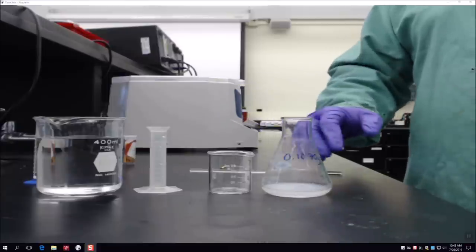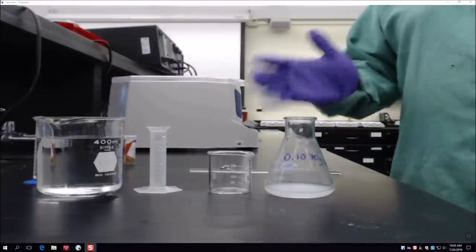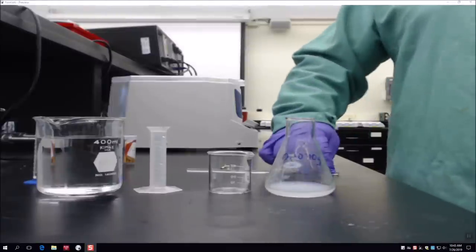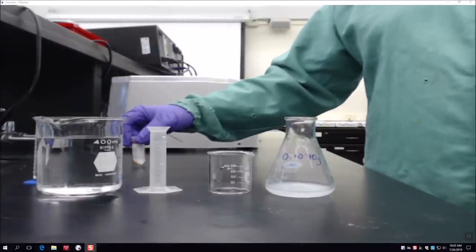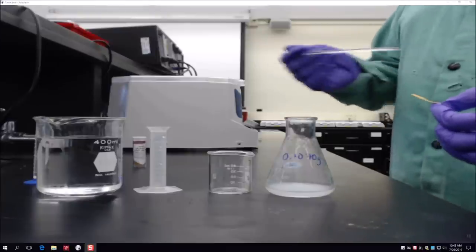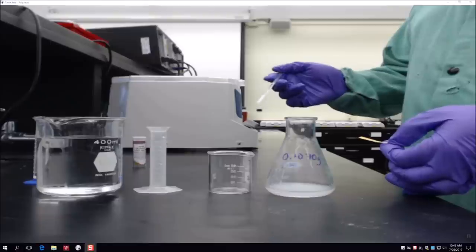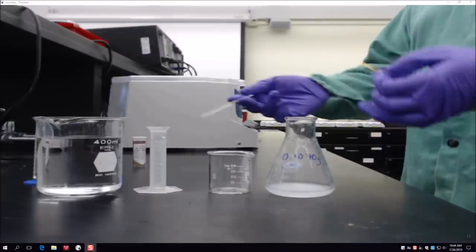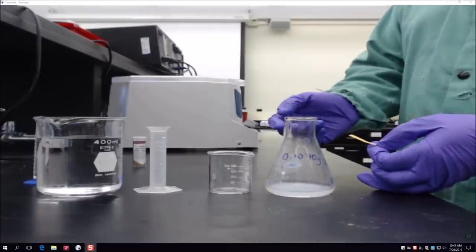A couple of things to keep in mind: make sure all flasks are still labeled. If no precipitate forms, you can check why using pH paper — ask your TA for some at the front of the room. If no precipitate forms, it means you haven't added enough sodium hydroxide to neutralize all the excess HCl from the first reaction before it can react with the magnesium chloride. If HCl is still present, the solution will be acidic, which you can test with pH paper.